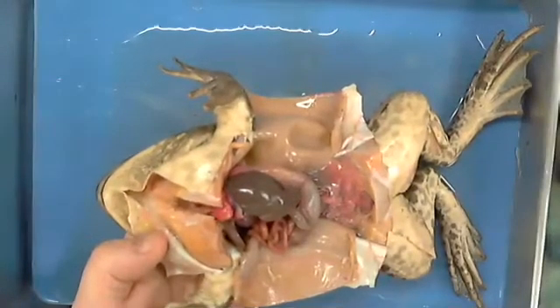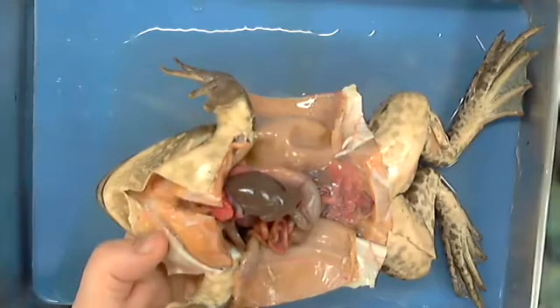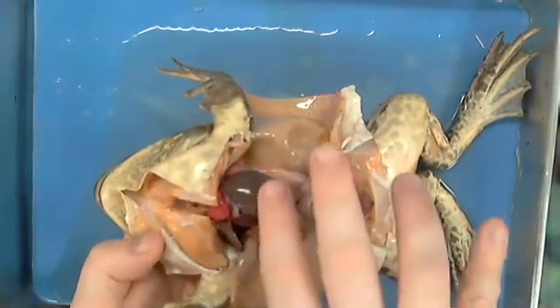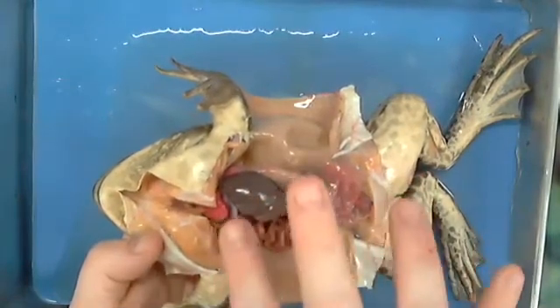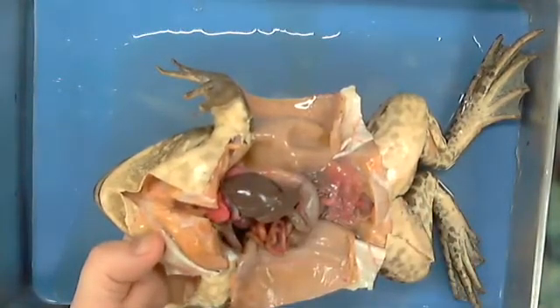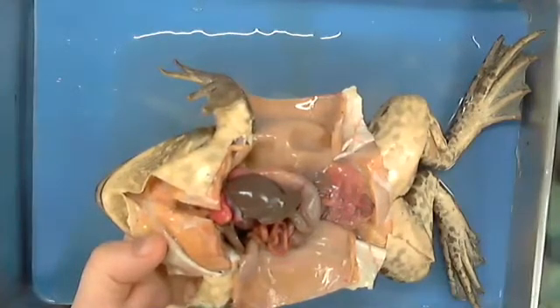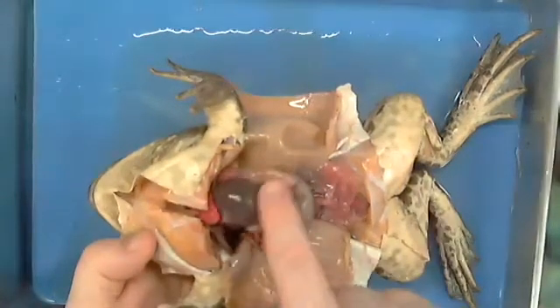So we would consider this to be part of excretory in the sense that it is a way of waste being removed, or we'd also call this part of our endocrine system, which is hormones. Endocrine, that's the word I was looking for. But its primary purpose is filtering blood. So that's what our liver does.